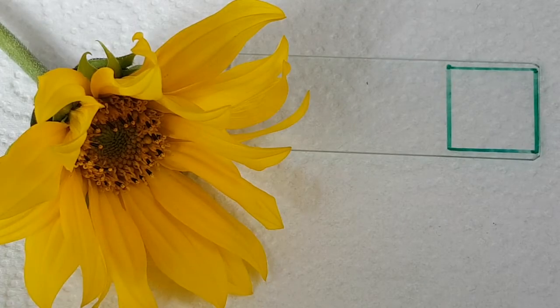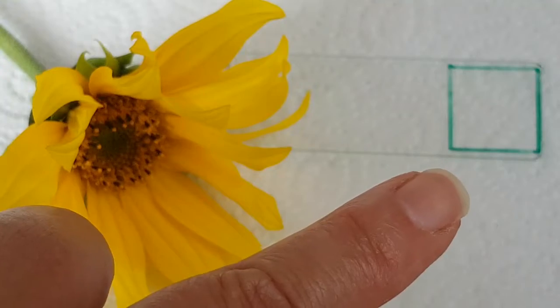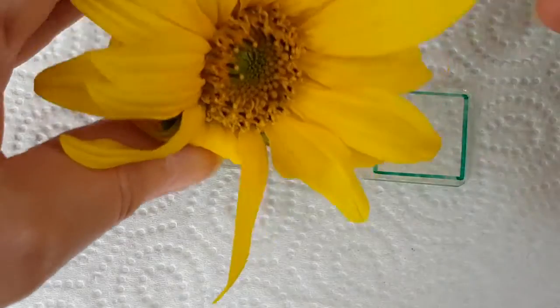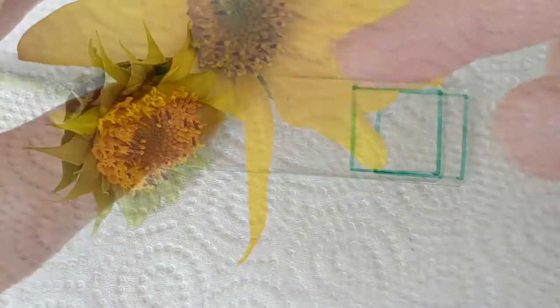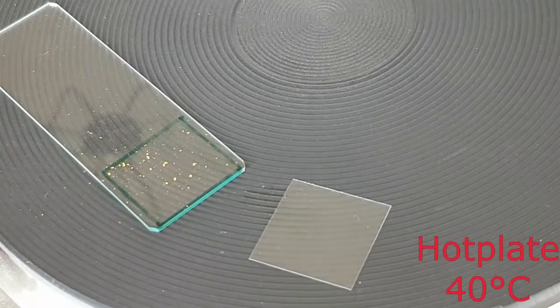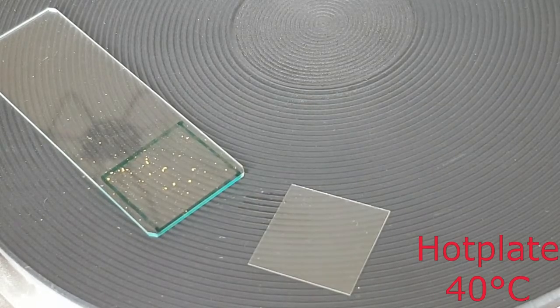Okay, here's the sunflower collected, and I've just prepared a slide so that I can put the pollen into that little square there. I've got a little bit of something there. What I could do, or should do, is dismantle the flower and take the petals off so that the anthers are more exposed. Okay, I'm just warming through my cover slip and my slide with the pollen on it.